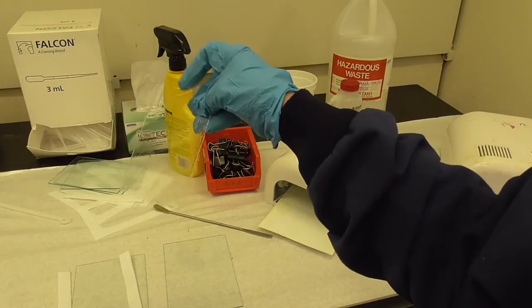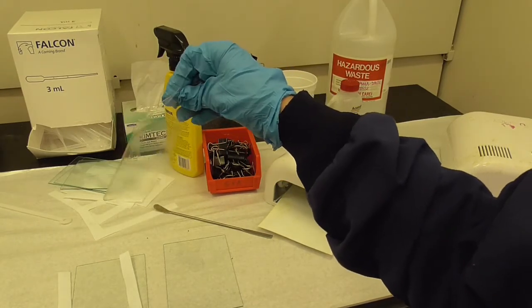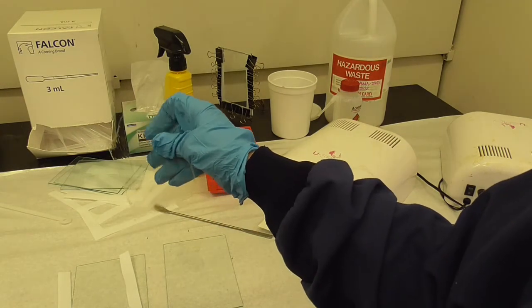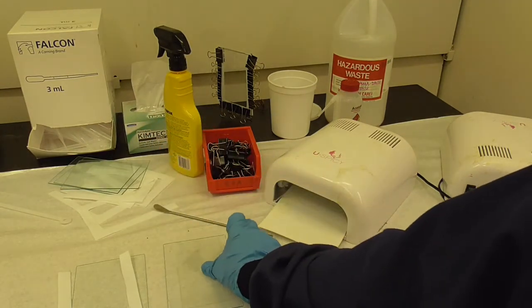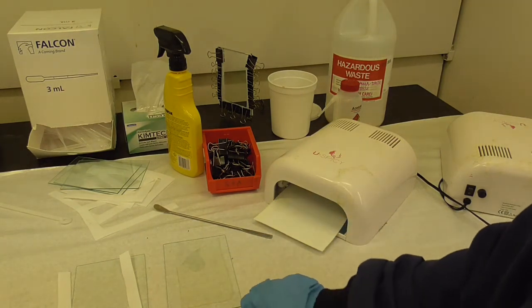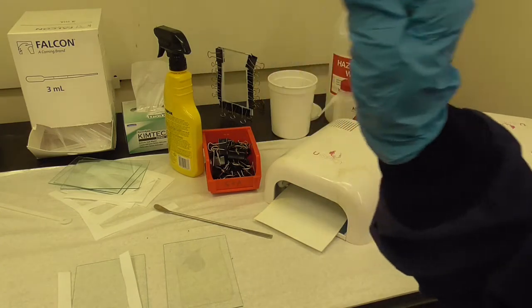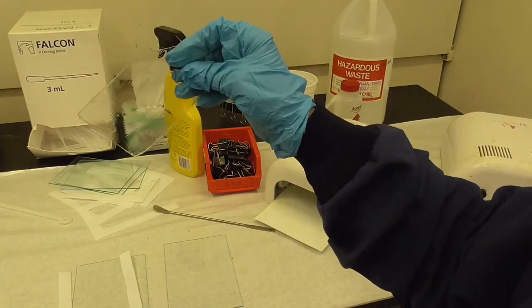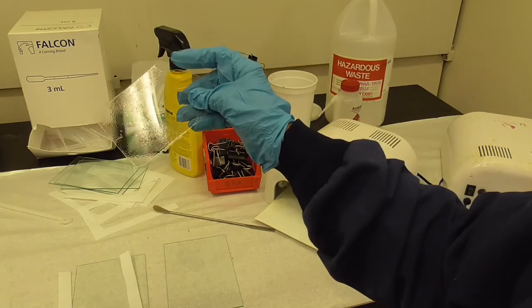If you take your polymer out and it's not quite solid enough, still a little sticky or tacky, you can actually just put it on the glass and put it back in here for about 5 minutes and irradiate some more. But if it is done, as this one is, you take it to the sink and wash it with soap and water.